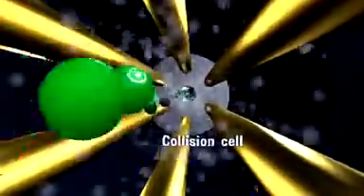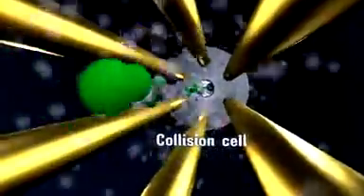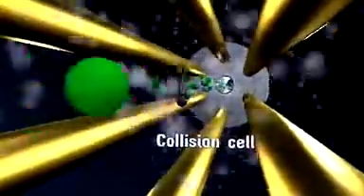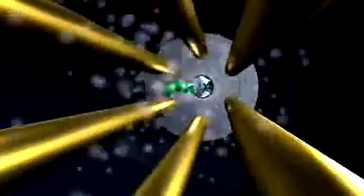In the hexapole collision cell, precursor ions strike collision gas molecules, generating product ions and neutral fragments. Linear axial acceleration and high collision gas pressure simplify operation and ensure fast, sensitive MS-MS without cross-experiment memory effects.